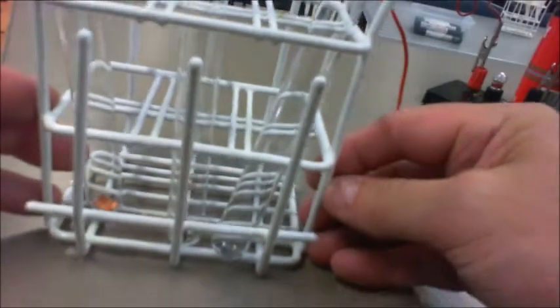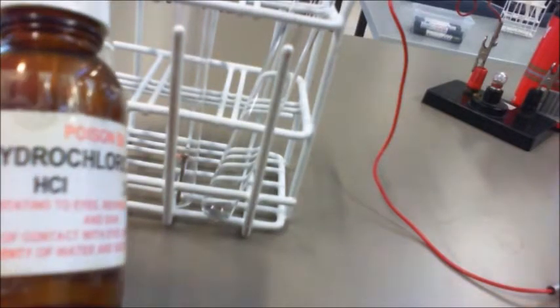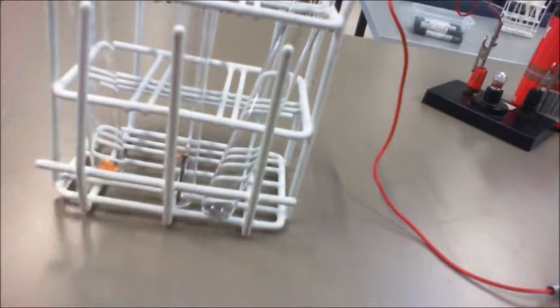Okay, our next experiment is looking at what happens when we add acid to them. So this is an acid reaction, and the acid that we're using today is our good friend hydrochloric acid. It's 2 molar, it's of reasonably high strength, and I've got our three metals. There's our copper, there is our iron, and there is our magnesium. What we're going to do is place a dropper full into each of those.